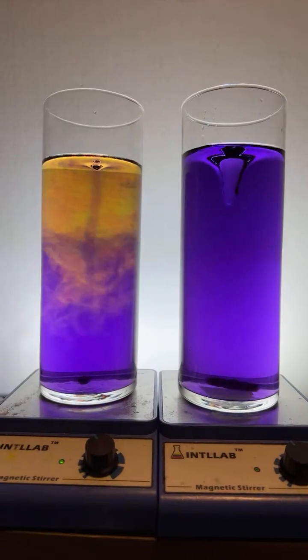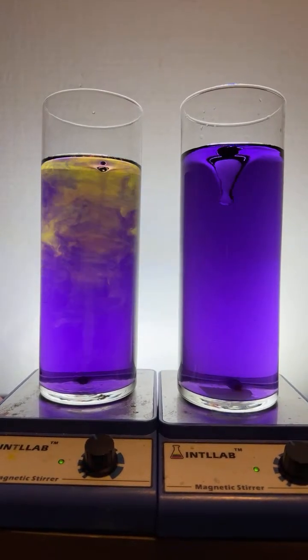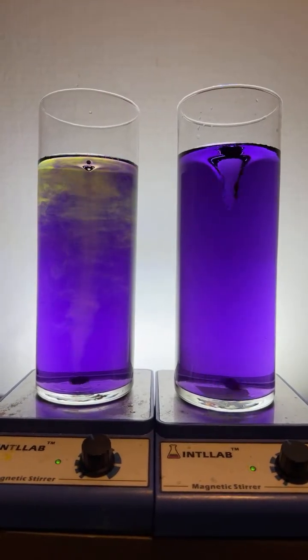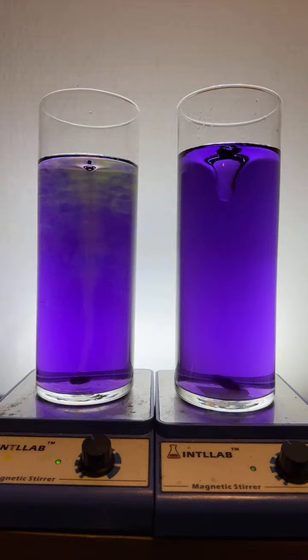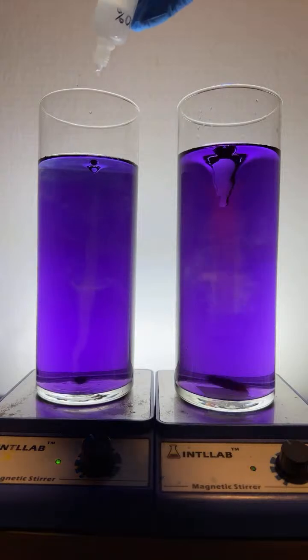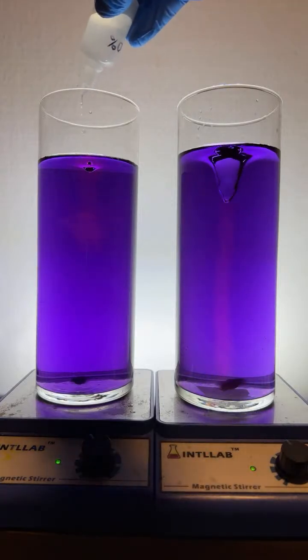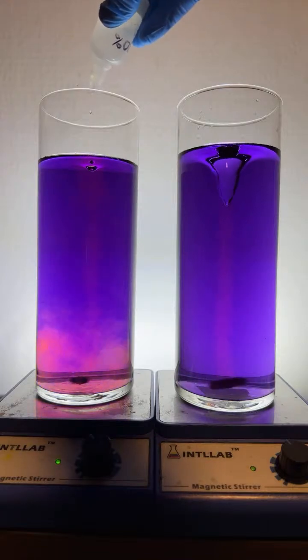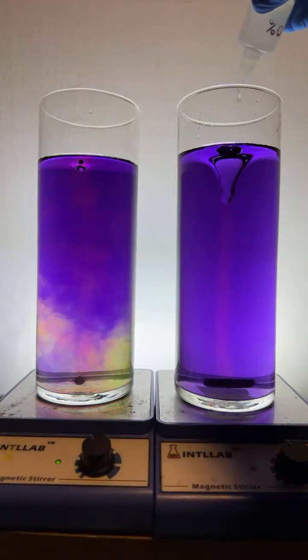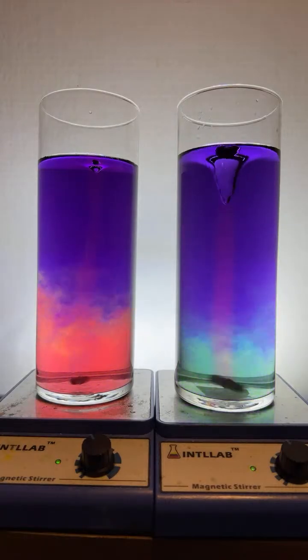Earlier, the glass on the left was buffered. How did I buffer it? Dominic, all I did is I added an Alka-Seltzer tablet to it, and that's going to add a citric acid buffer to the system. If I remember correctly, I have to sit and think about it. I want to be careful, but I think it's a hydrogen citrate, dihydrogen citrate buffer.